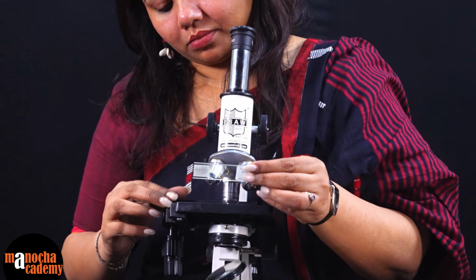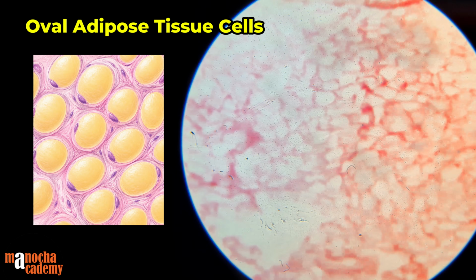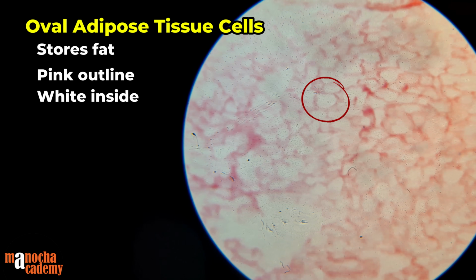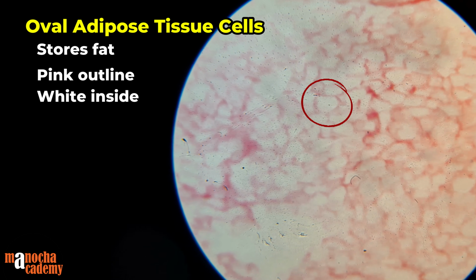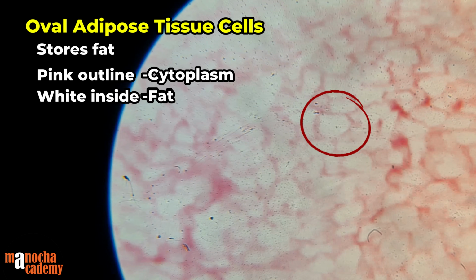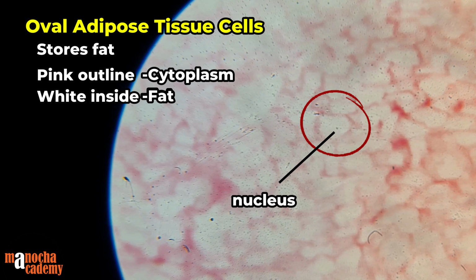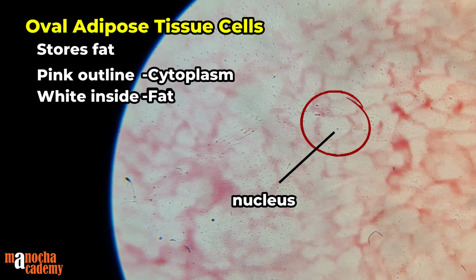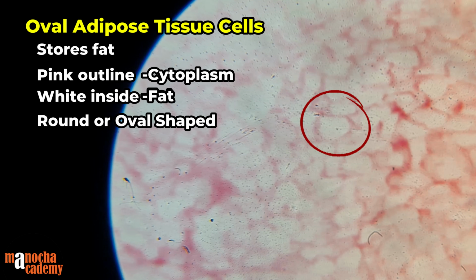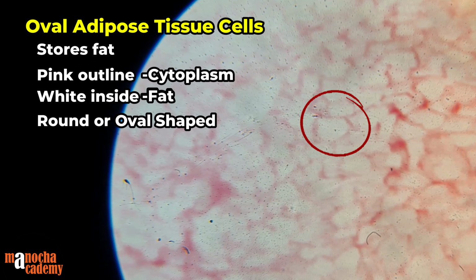Moving to the next one, this is adipose tissue cell, and adipose tissue is supposed to store fat. So as you can see, most of these cells have a pinkish outline and a whitish inside. So that whitish inside is basically stored fat, because fat is white in color, and the pinkish outline is the cytoplasm that has been pushed towards its periphery. The nucleus is also there. If you see in much higher magnification, you will be able to see the nucleus, but these are round or oval in shape. They are round because they have lots of stored fat and they have increased in their diameter, so they are round in shape.